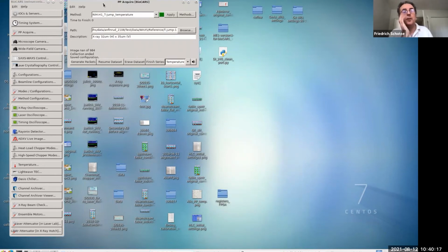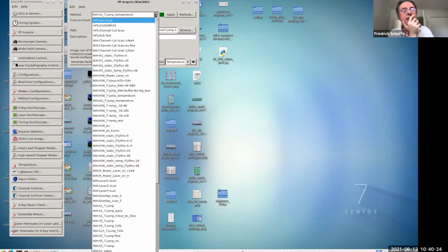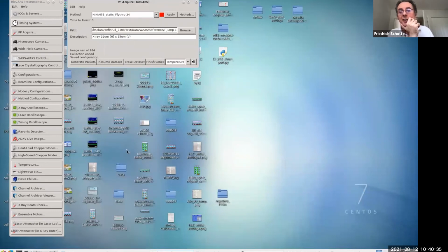In PP acquire, the first thing you do is you select a method. So you want, say, a very simple data collection, a static data collection. For example, this one here, NIH, the one we used, that just collects X-ray data. It doesn't change any variables. So you can apply this here. The next step is entering a destination. So for this static one. And then we are ready to acquire the data set. So this will be like 512 images. We are not going to wait it out. I will cancel it after maybe 10 or 20 to see the progress here.